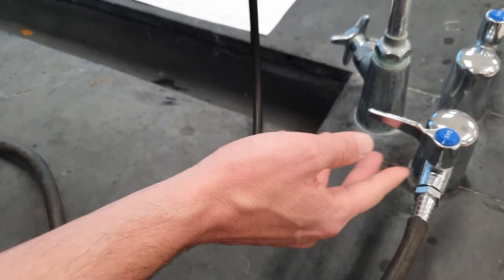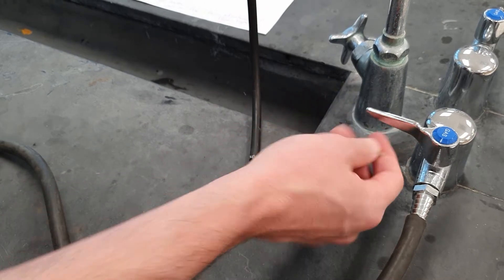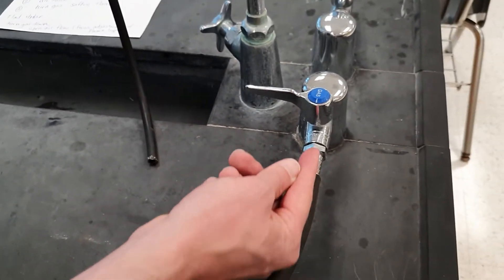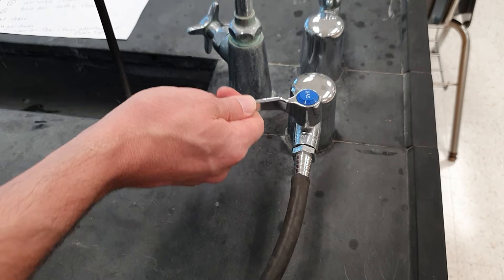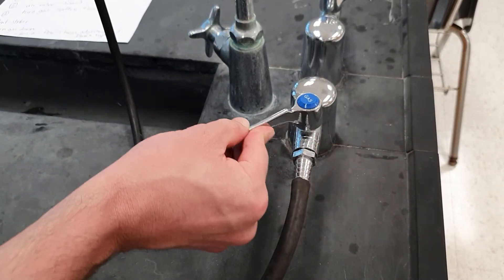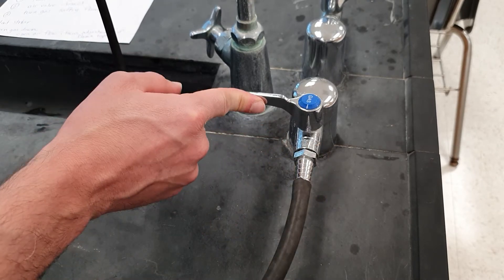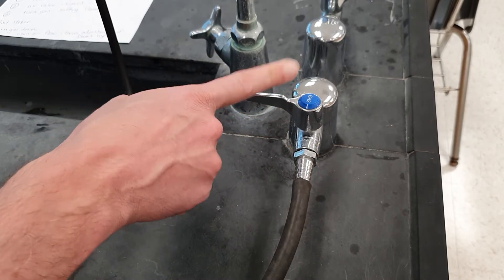How do you know whether it's closed or open? You know by the position of this. This is the handle. When it is not lined up with this, it's closed. So this is open. This is closed. This is also closed. When it's open, don't open it part way, open it all the way. But that'll be what we get to in just a little sec. That is actually not the first step.